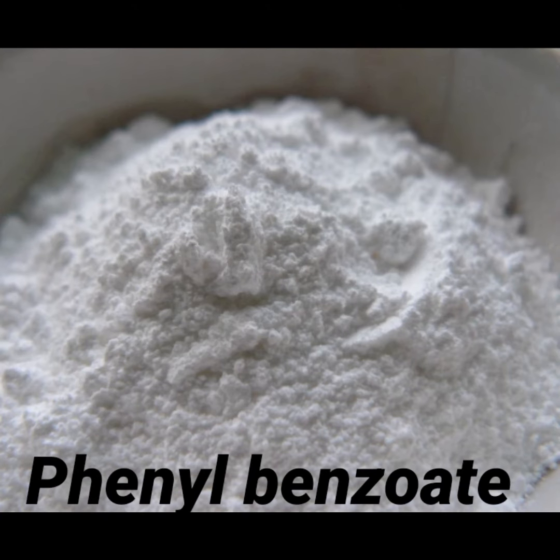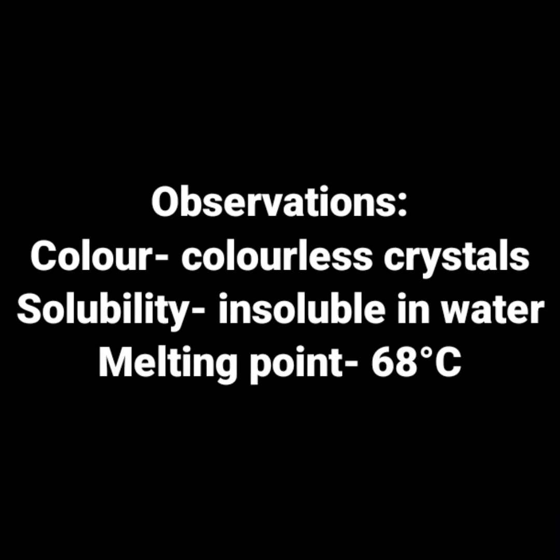This is the phenyl benzoate prepared, and the observations are that it is a colorless crystal. It is insoluble in water and its melting point is 68 degrees Celsius.